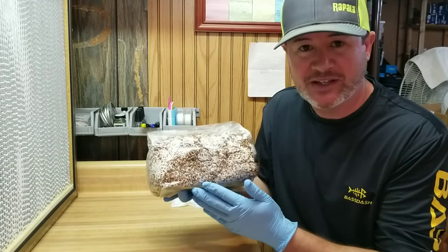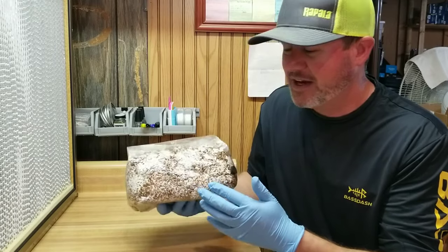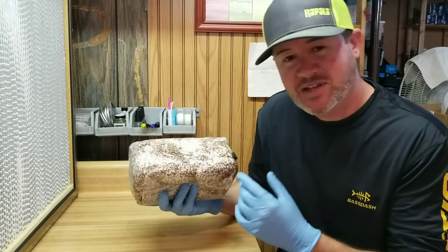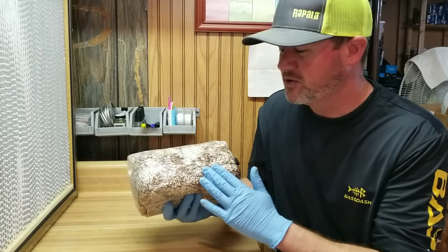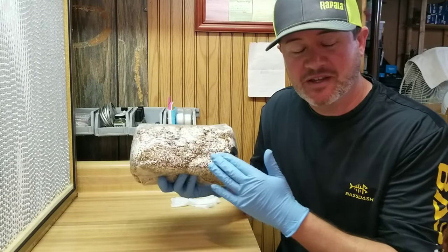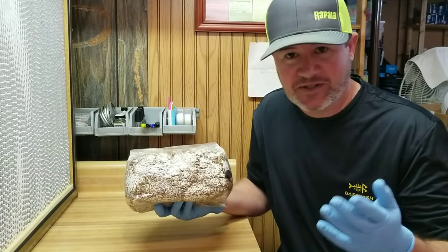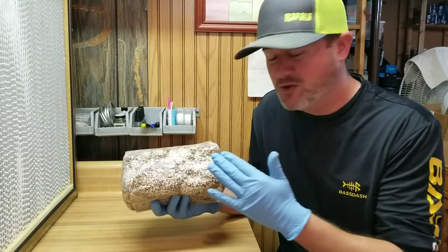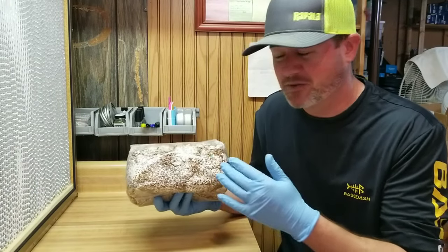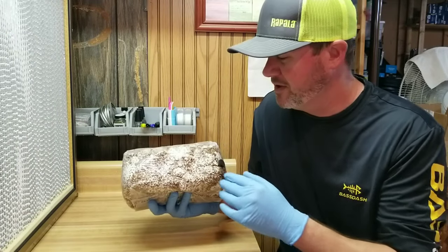This is just a bag of wheat spawn that I bought from a spawn supplier online — including shipping, it cost me about $30. What I'm going to show you today is how to capture some liquid culture from a grain spawn bag. This is a cost-effective way to get a culture rolling, because not only do you get liquid culture of this strain that you can expand and grow for years, but when you're done you also have a bag of grain spawn you can still use.